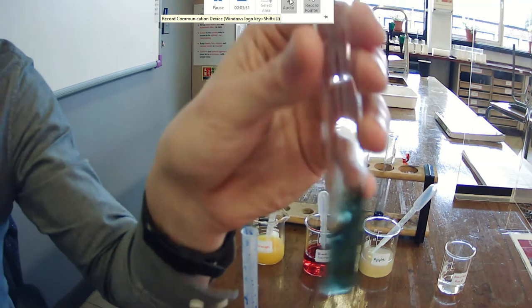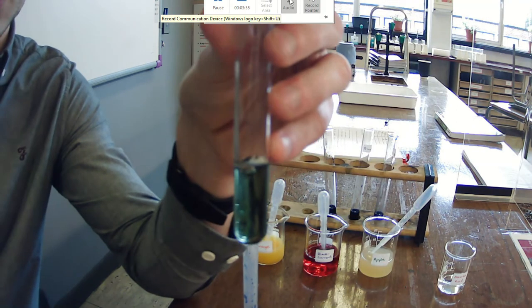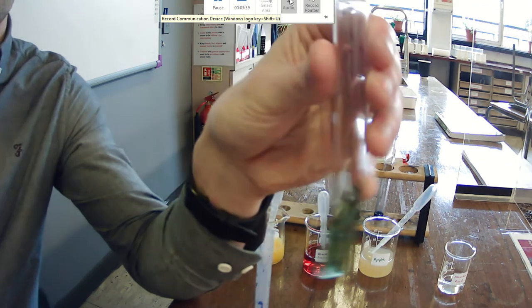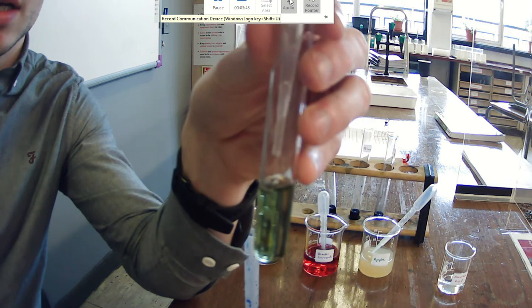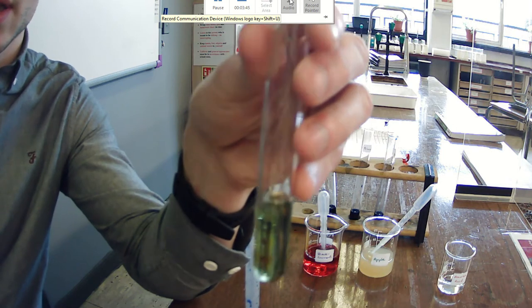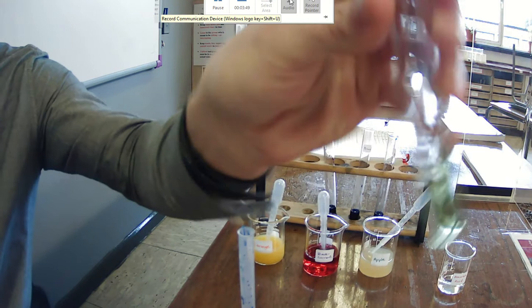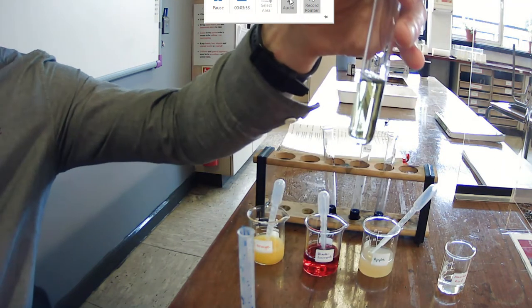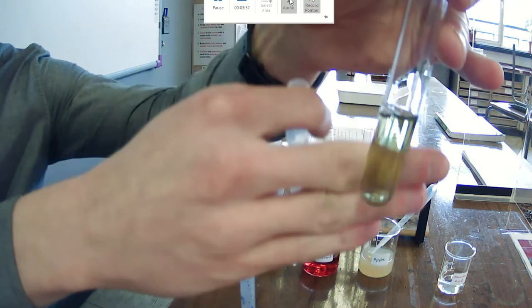Okay, so I'm just continuing the video here. We've just done 18 drops and you can see it's almost colorless, so we're going to go 19 and 20. And at 20 drops, you can see that that is now colorless, see-through.